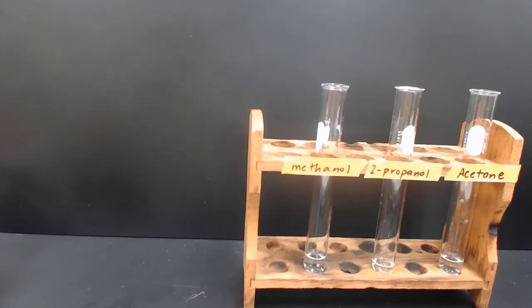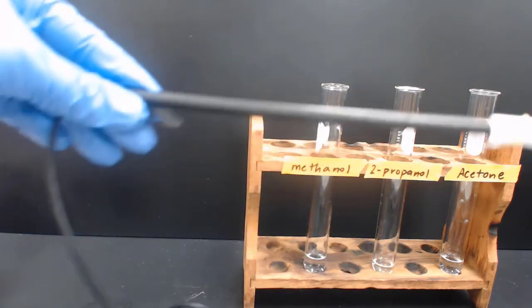Here I'll be demoing experiment 14, intermolecular forces, for parts 1, 2, and 3. We'll give data, but I will show you 3 demos and provide the graphs that go with them so that we can see the temperature change as they evaporate. So first we'll start with 2-propanol, which is at the top of your data sheet.